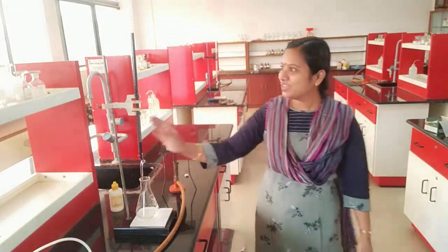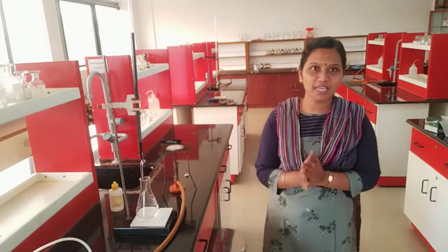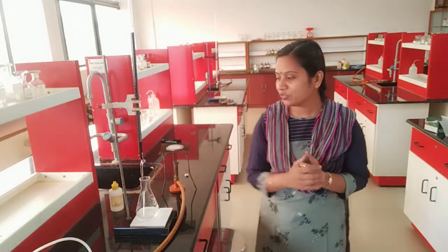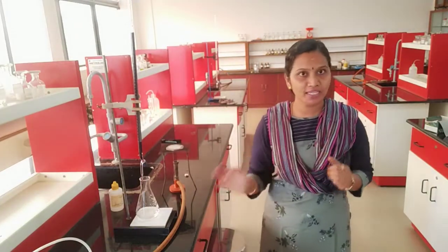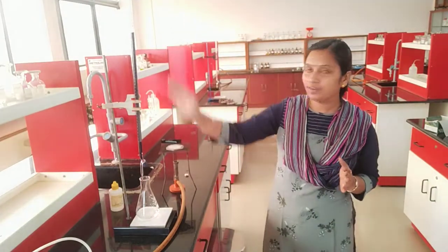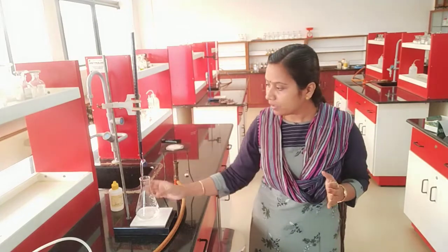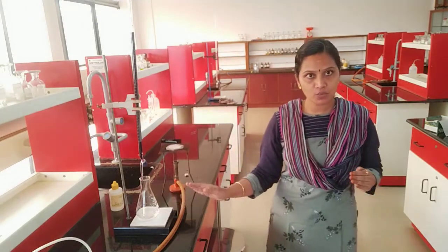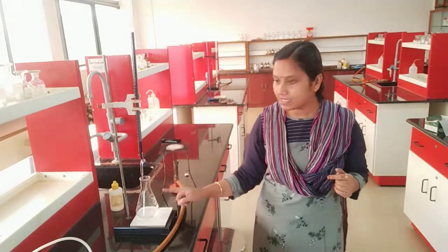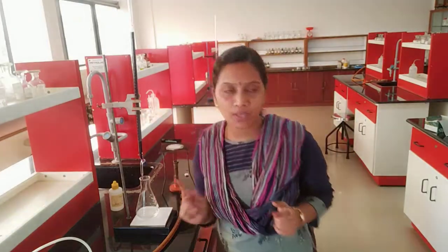Okay children, so we are trying the duplicate of the second experiment, that is titration of KMnO4 against Mohr's salt. For that I have filled my burette with KMnO4, and I have taken Mohr's salt 20 ml and 20 ml sulfuric acid in my titration flask.